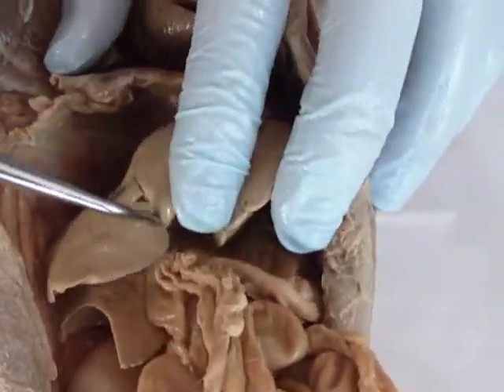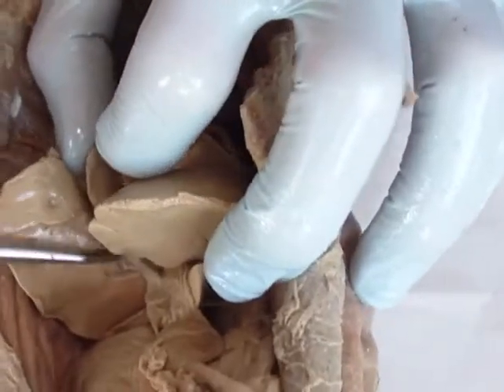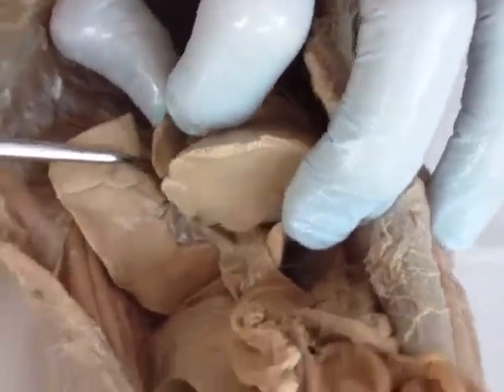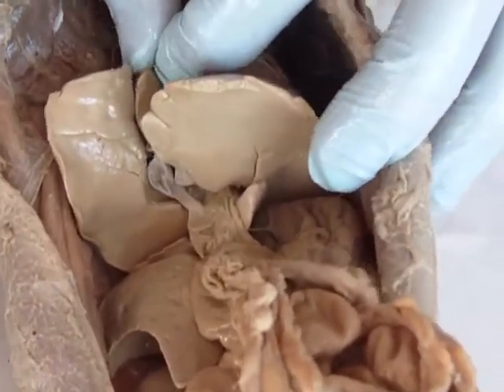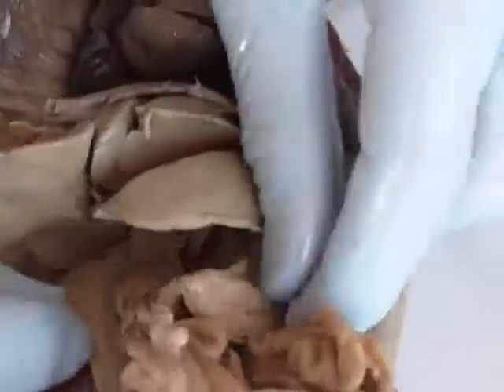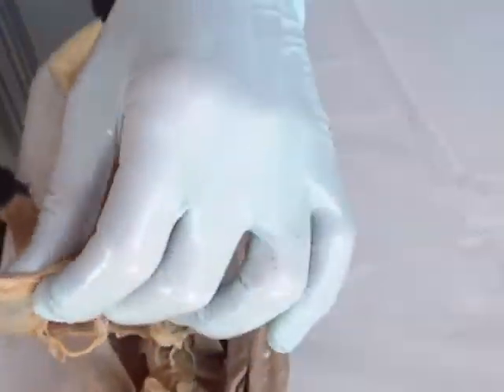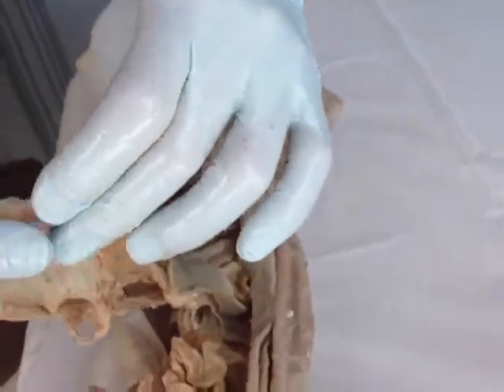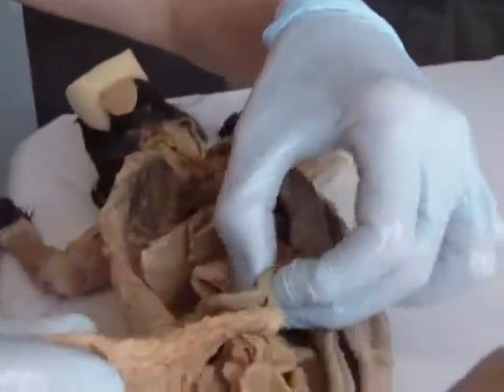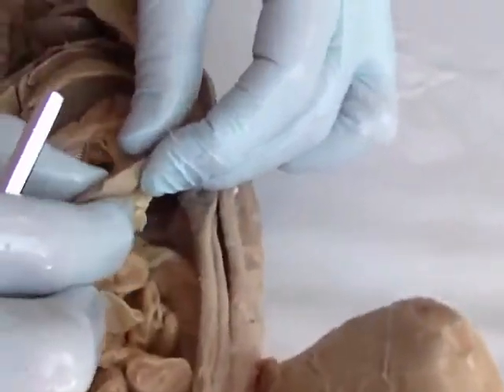Wedged right in the middle of your right medial lobe is your gallbladder, right in there. Now you have this apron here — this is your greater omentum. Attached to your greater omentum is the spleen.